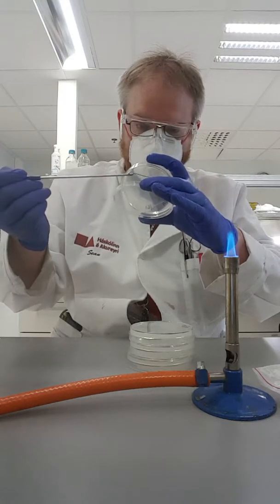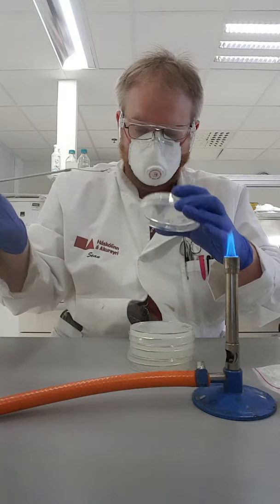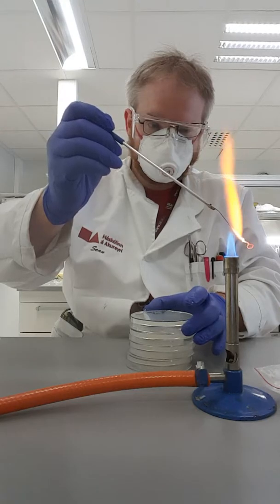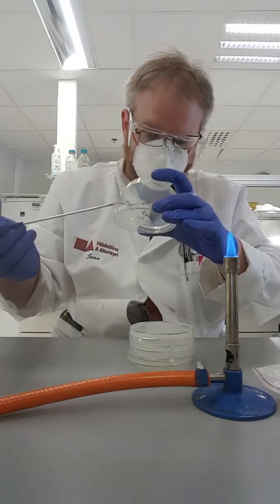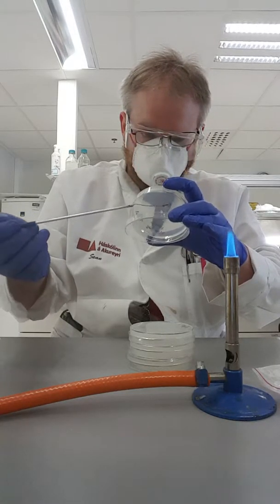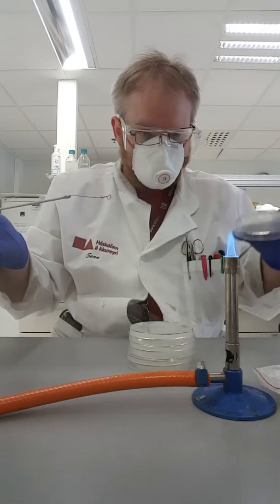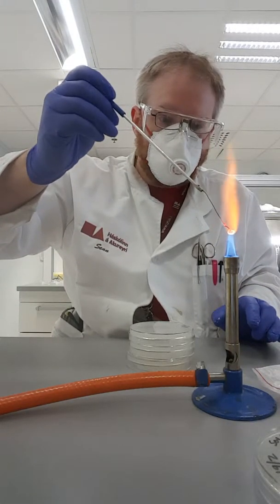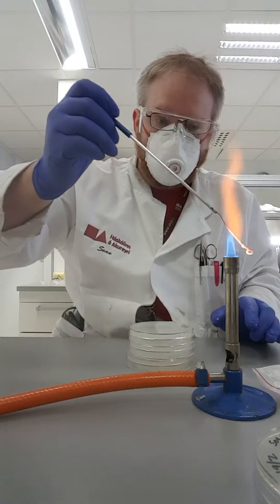Go in a new direction. And one more time. Okay, so that's one plate. Now I want to do this again just because I want to see if I can get some different bacteria or yeast.